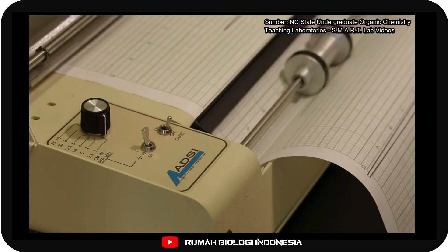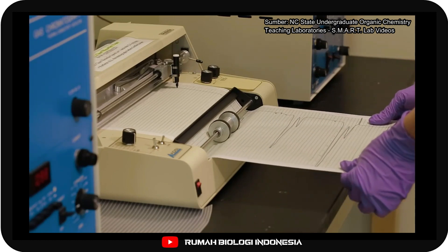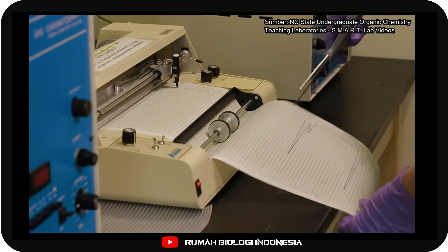When you are finished, turn off the chart recorder. Feed the chart paper to remove all chromatograms from the chart recorder. Cut with scissors.